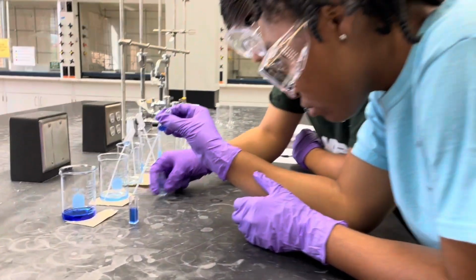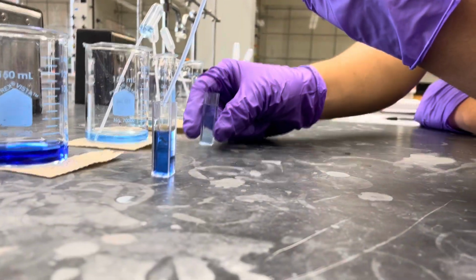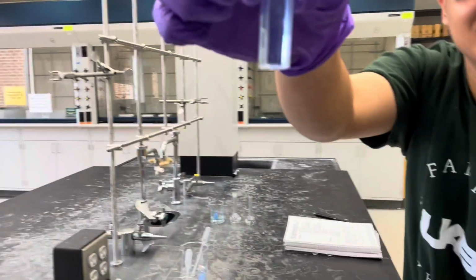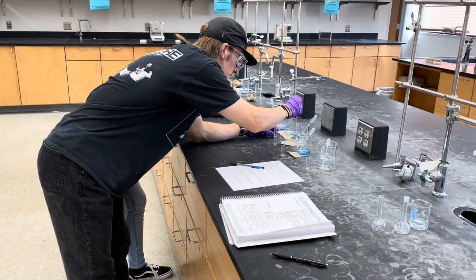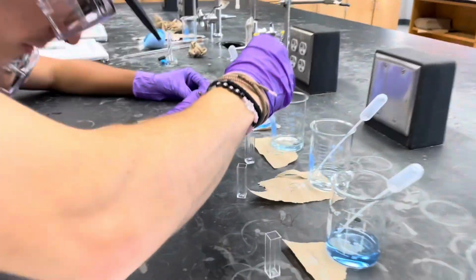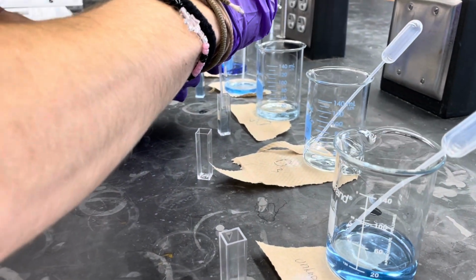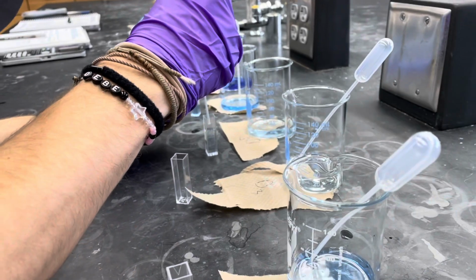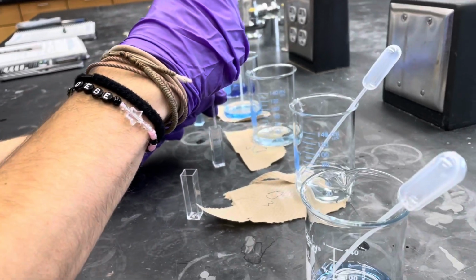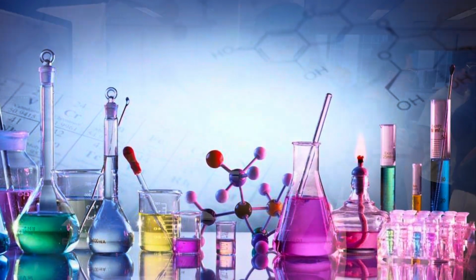After you've completed all of your dilutions, you should have a total of 3 dilutions, a stock solution, and simply water. We're going to transfer all 5 of these substances into their own individual cuvettes. Take note that on the cuvette there is a very tiny line. You want to fill up to it as close as you possibly can. Don't go over it, as we don't want to overfill the cuvettes and risk spilling. Now let's run on to the spec room.